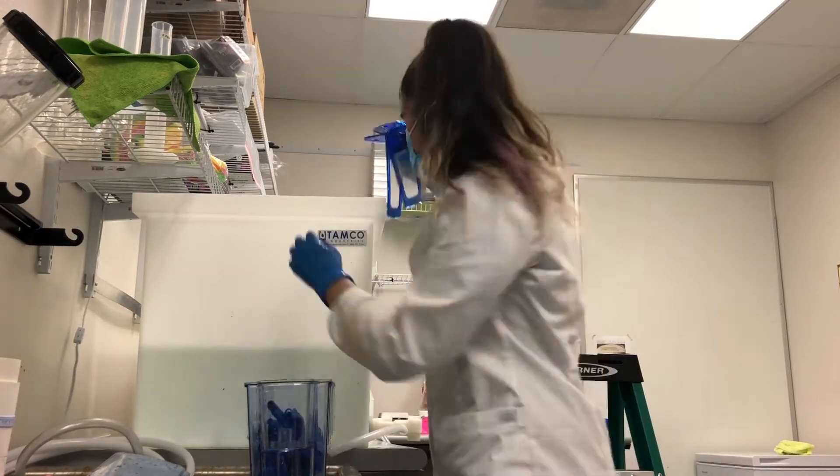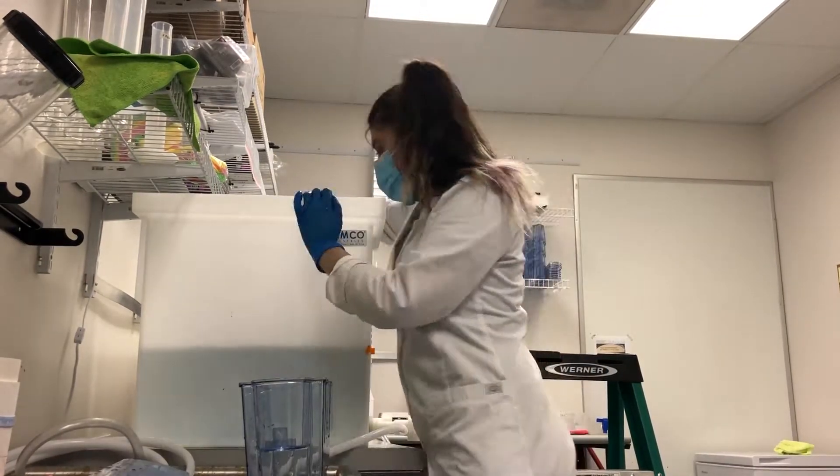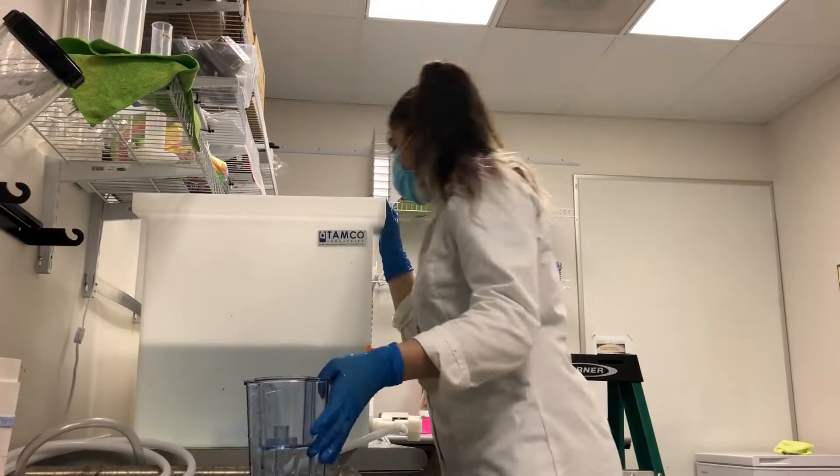We make sure that all of the dishes are completely covered by the 10% bleach solution and we will leave them in the solution for 30 minutes to disinfect them.